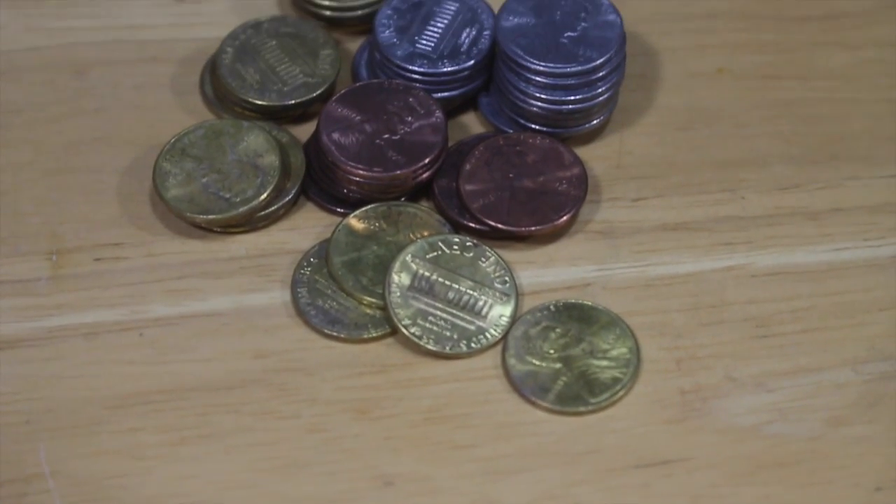You can see just how profitable this business could have been. I mean, those really look like silver and gold coins. So it's a pretty simple reaction — we're reacting the copper and the zinc and combining them into an alloy that we call brass. And brass has a very gold-like quality, so it looks like gold, but sadly it's still just worth a penny.